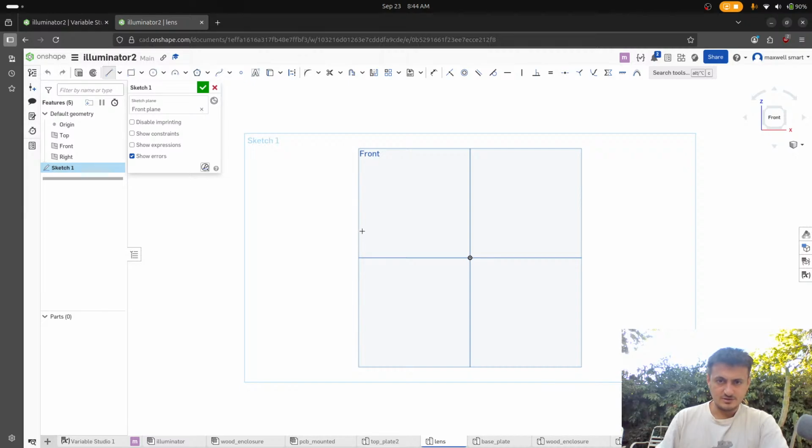So, I guess what I'm going to try to do is like this type of thing where I go boom, boom, boom. The thing is, let's see. One thing that we need to do is work out. Okay, this thing actually doesn't extend all that much. So when it's at 10, the thing is it actually comes in a little bit at 12. And it bottoms out at like 15, it looks like. Or maybe like 14. And it comes out to 24. So we don't know really what that's going to be. So maybe what we'll do is we'll design two parts and one part that just has a good range on it.